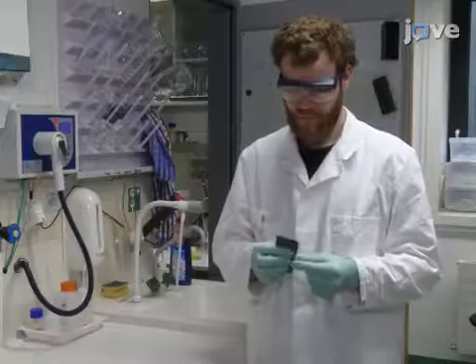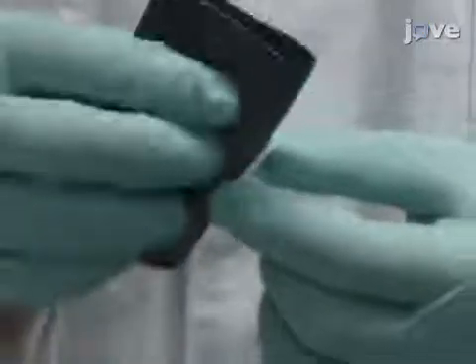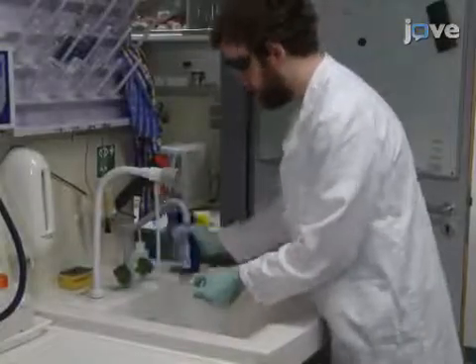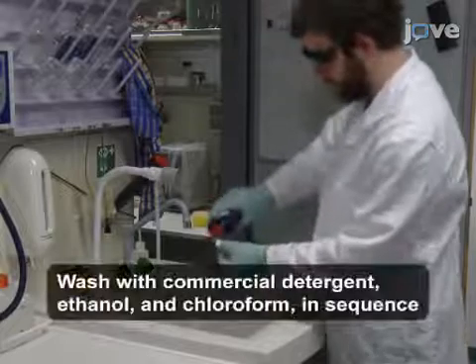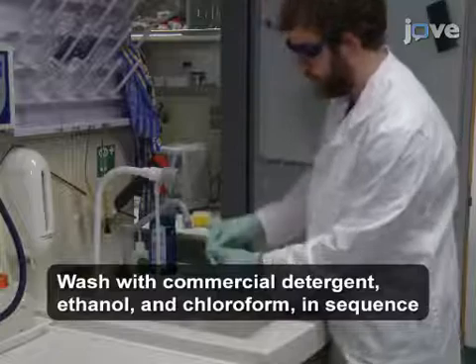To begin the procedure, roughen one side of a PTFE plate with fine sandpaper. Wash the plate, a 15 milliliter glass vial, and a sealable glass container with commercial dishwashing detergent, ethanol, and chloroform.